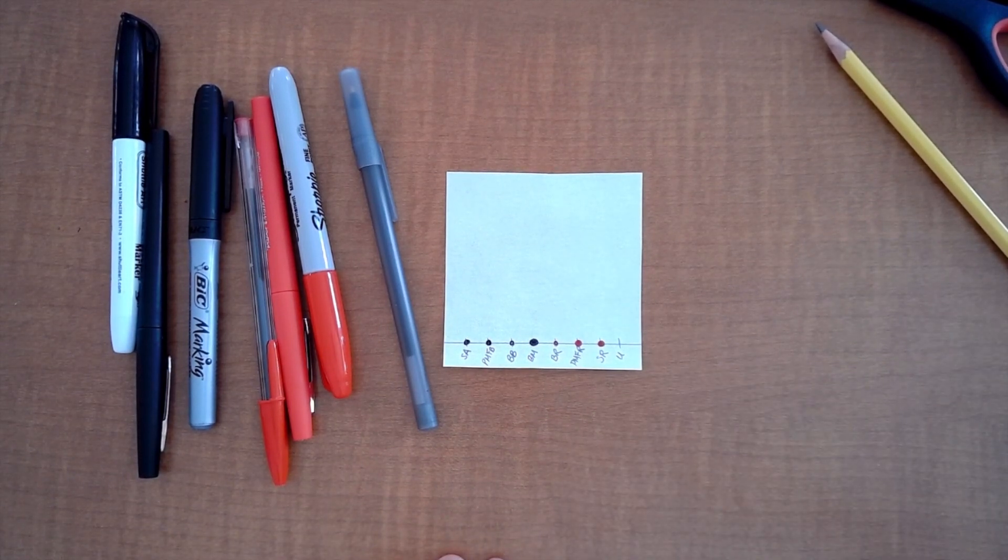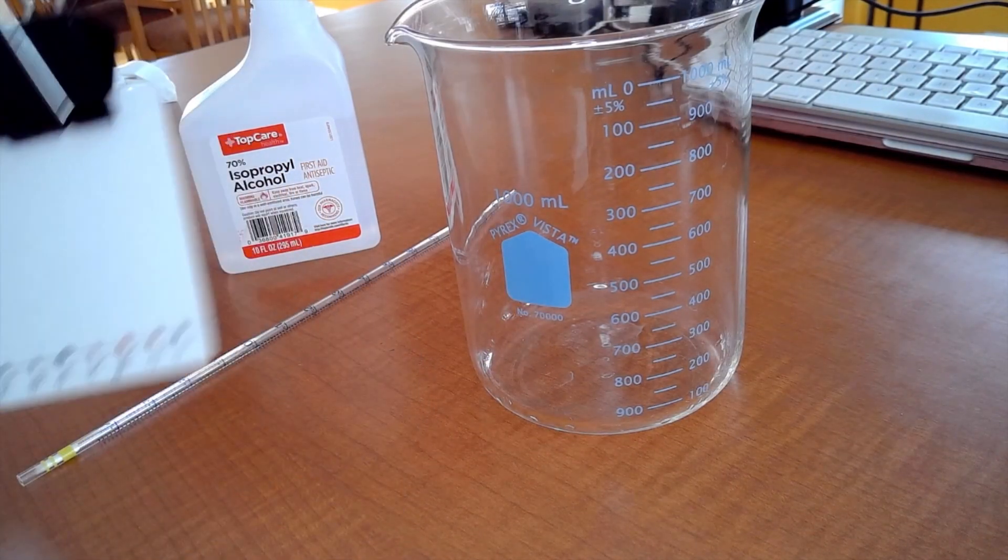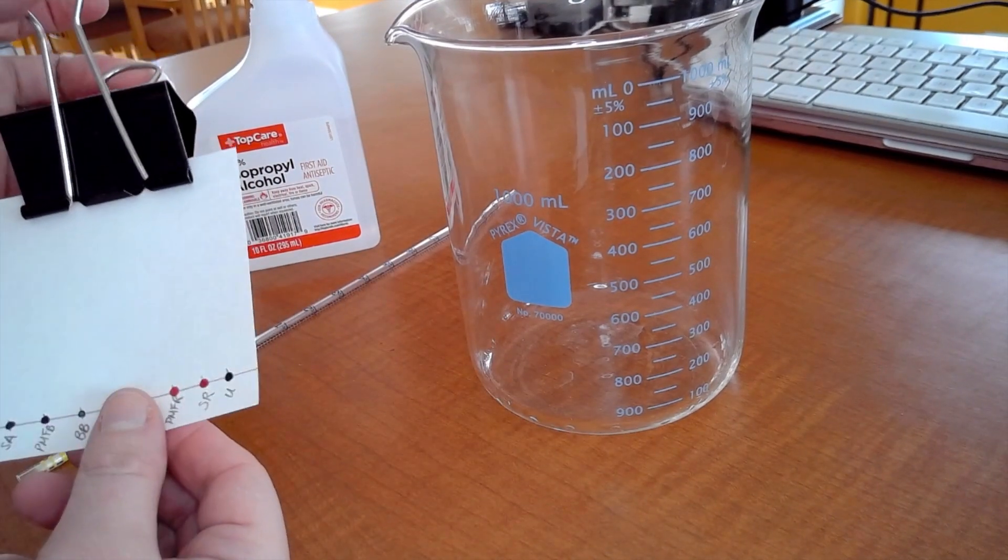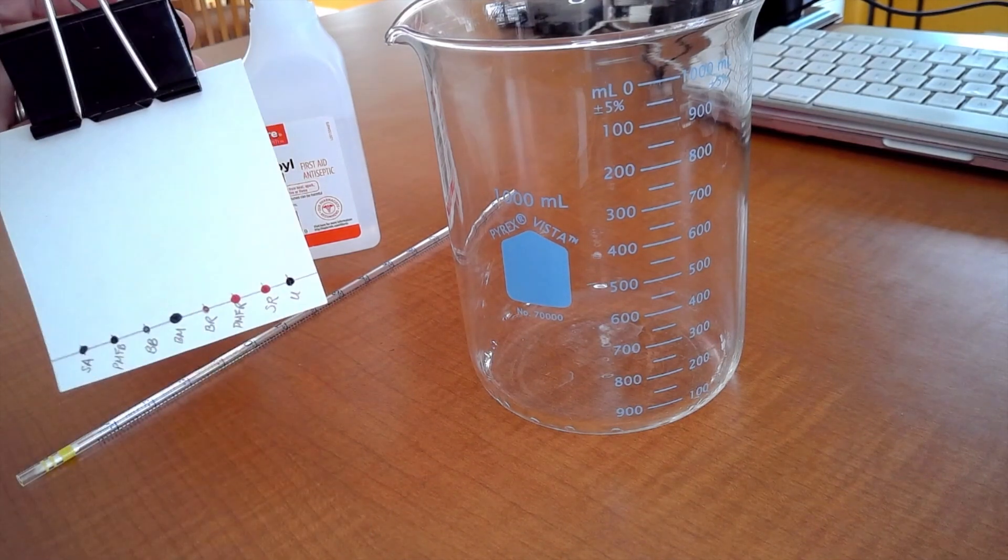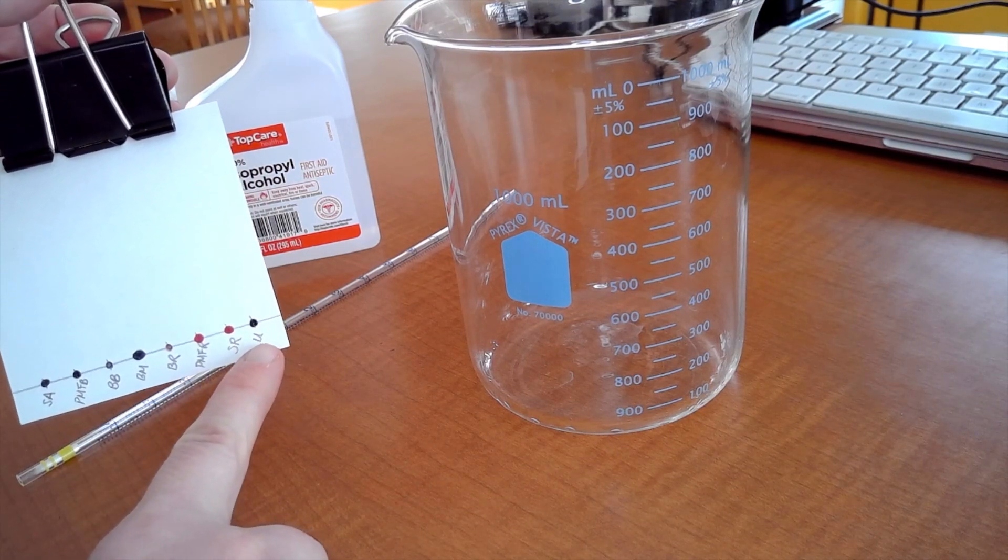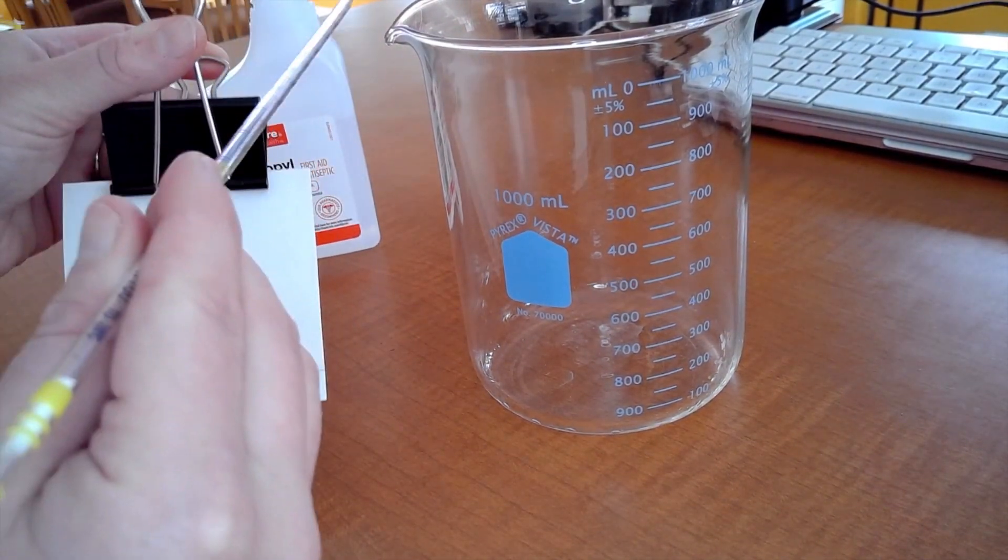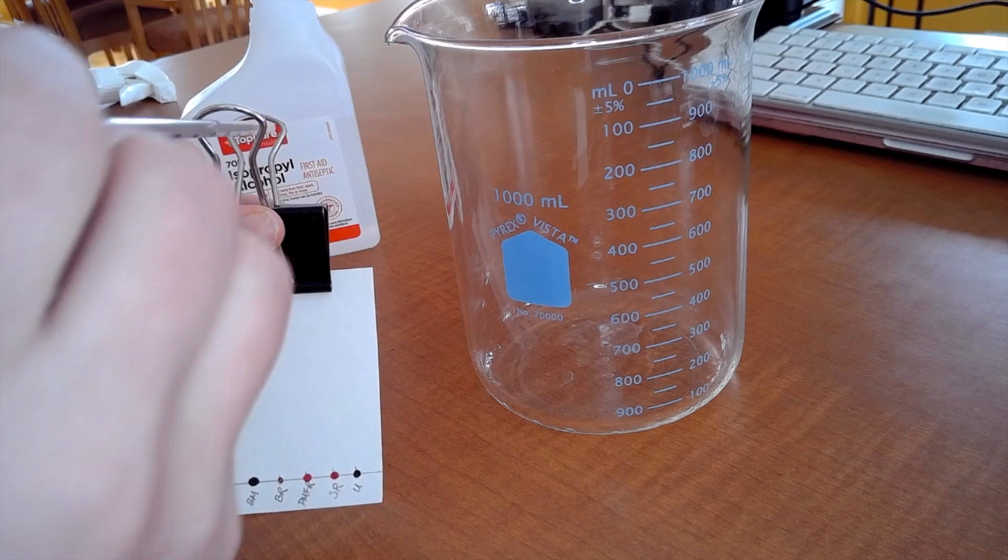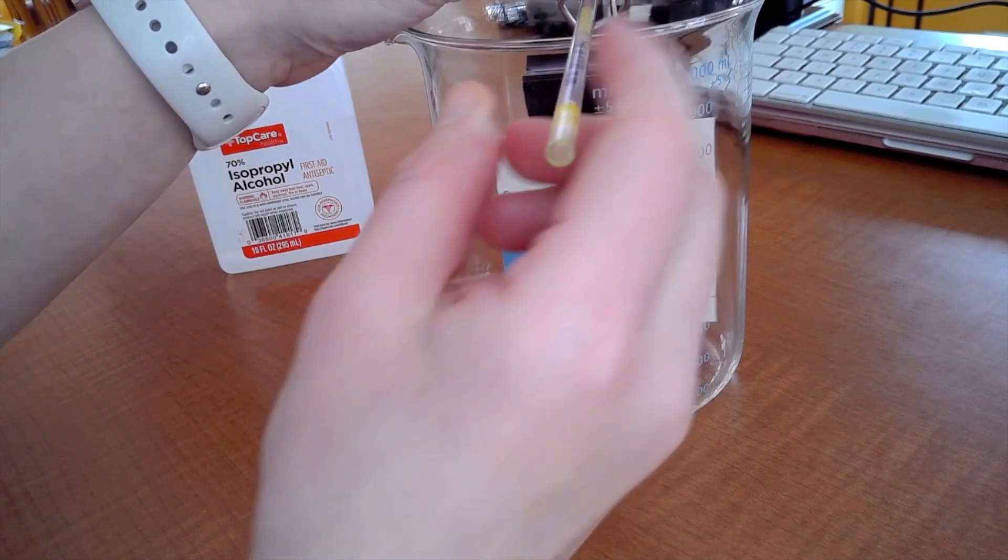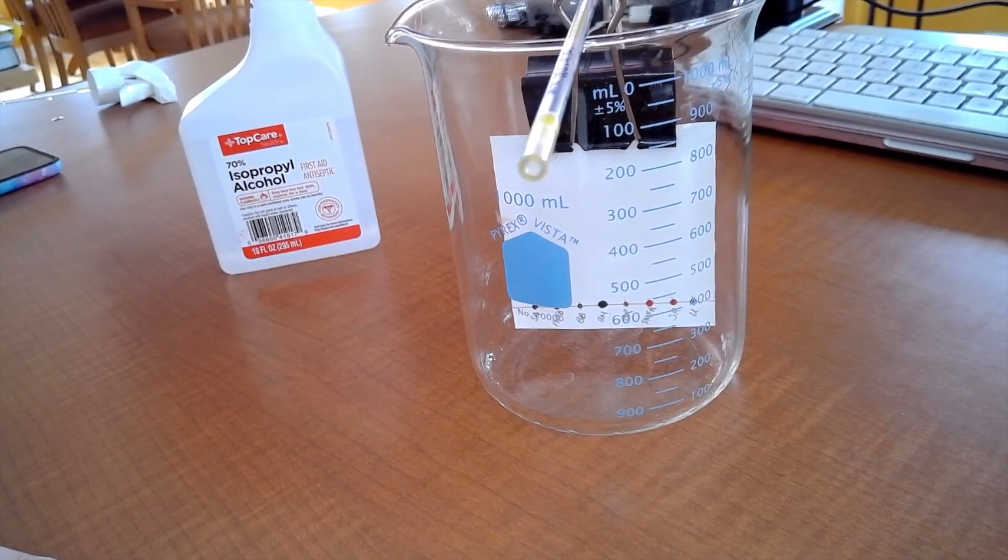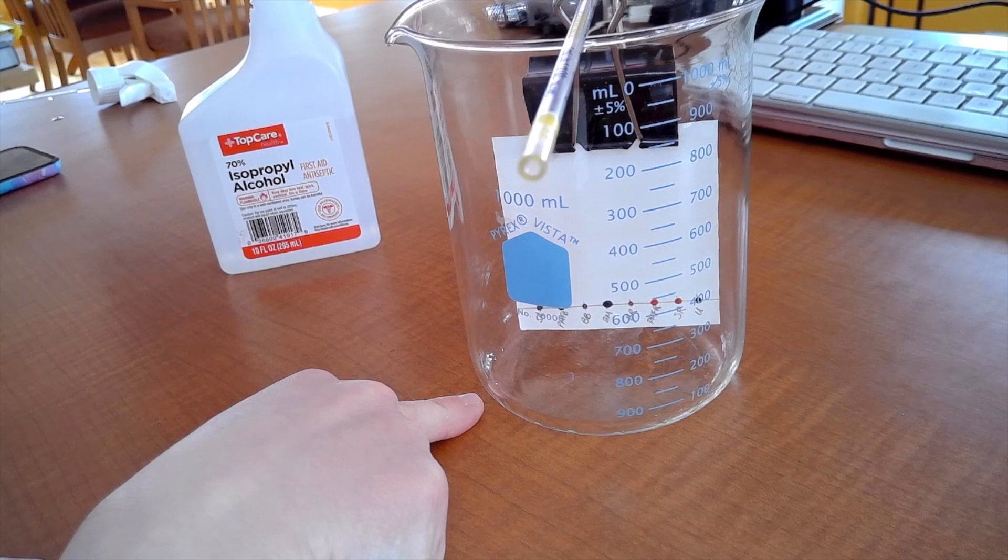So here's what I need for chromatography. As you can see I have this large binder clip and what I've done is I've clipped, want to make sure it's a good one that's nice and tight so it doesn't fall out, you want to clip your chromatography paper all marked up and you can see somebody did the unknown I don't know what it is mystery. You want to clip it like that and then you're going to use your pipette here and you're going to take your pipette and you're going to put it through and then you can do this right here.